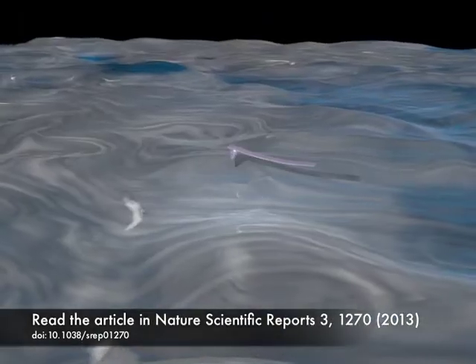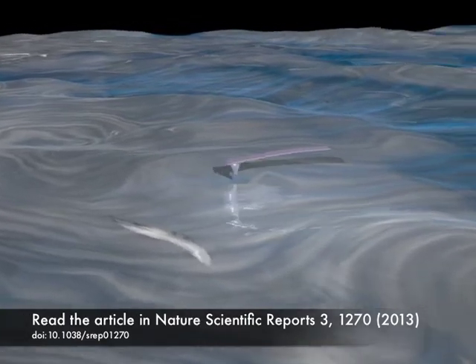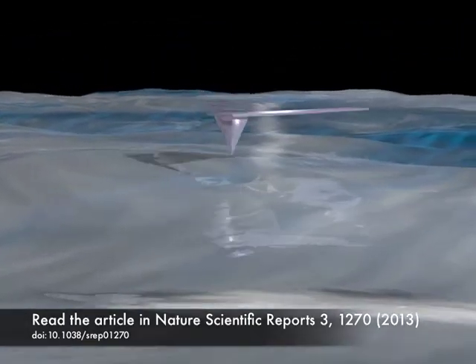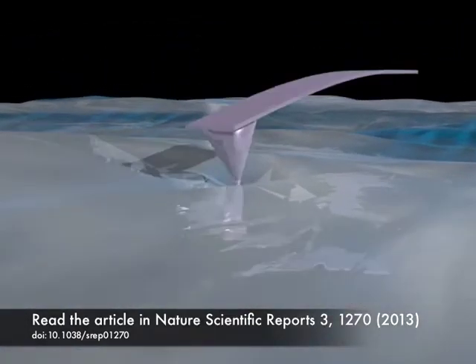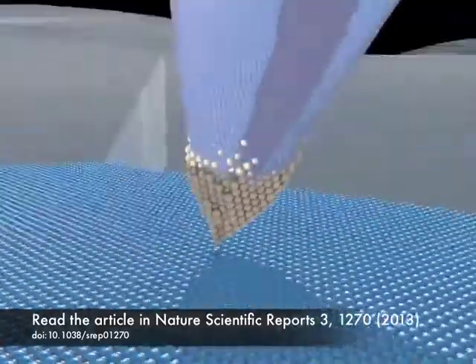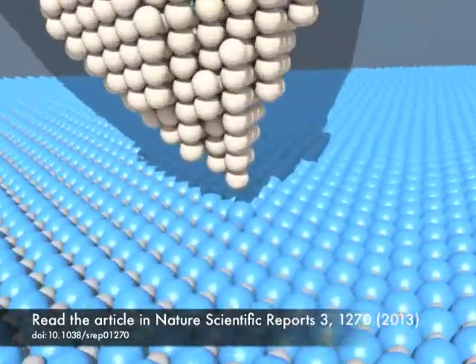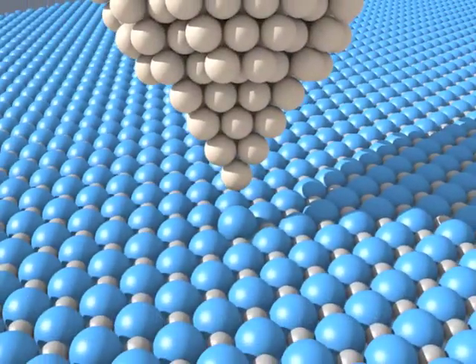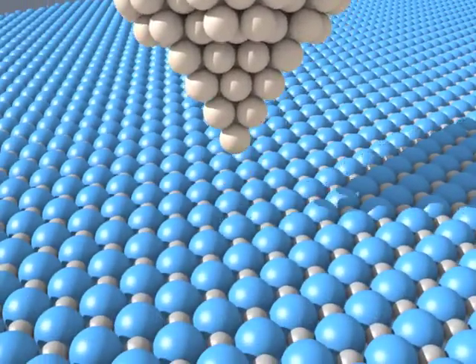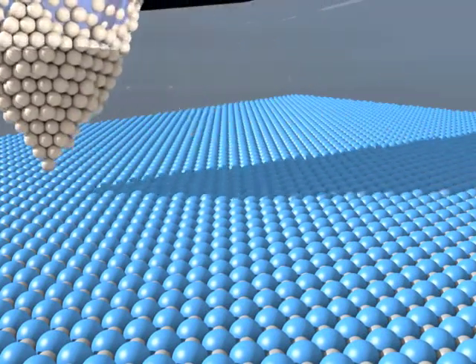An atomic force microscope, AFM, works so that a very sharp tip — atomistically sharp even — is brought close to the surface being studied. When the tip is just a few angstroms away from the surface, it can feel a nanoscopic force, and an image of the surface can be obtained by scanning with the tip.